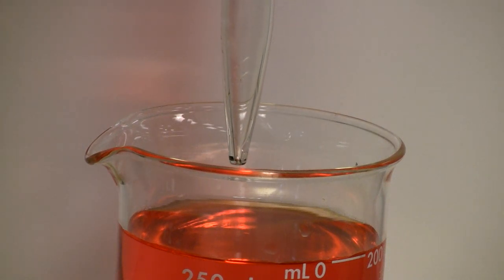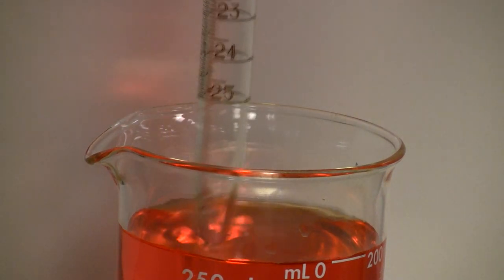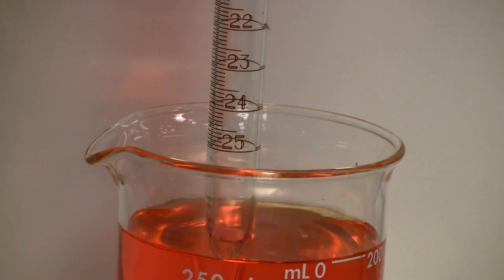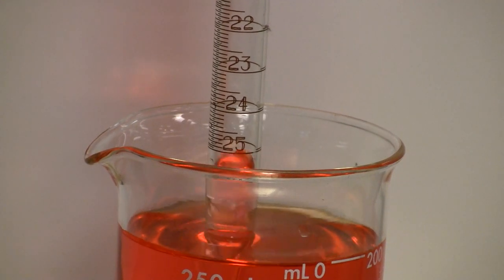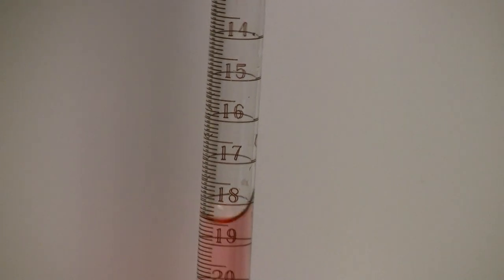To use a pipette, draw up slightly more liquid than you need to dispense. It's not necessary to pull liquid all the way to the zero line. Remember, after drawing up enough liquid with the pipette bulb, you will use your finger to control the flow.